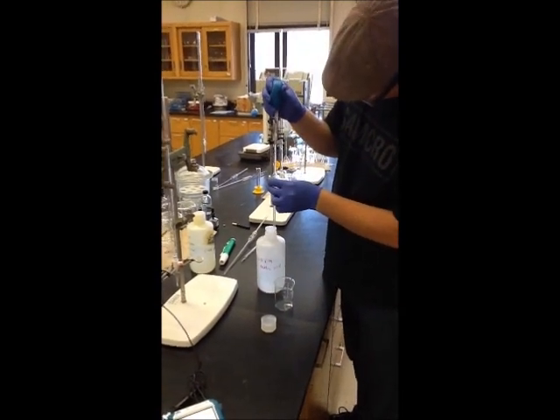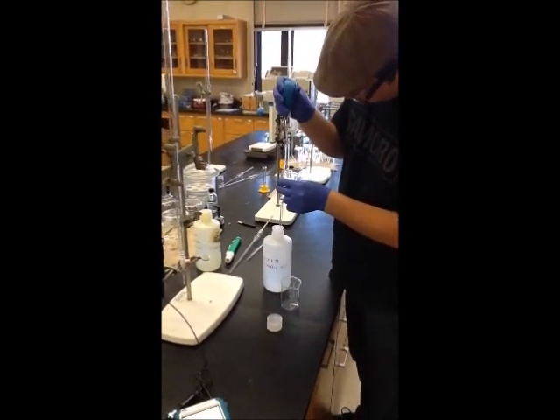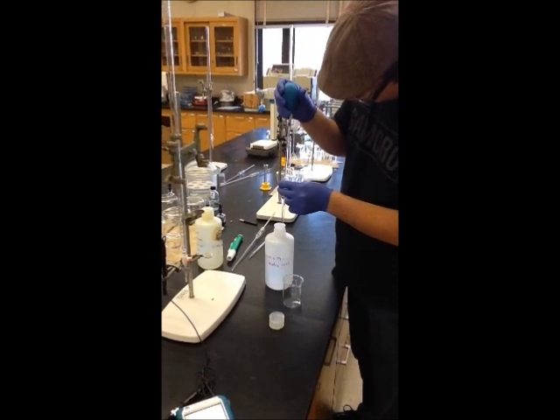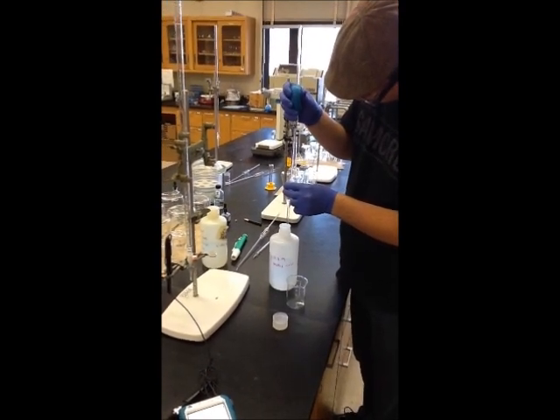To start this titration, we pipetted 25 milliliters of 0.1 molar acetic acid into a beaker to be titrated.